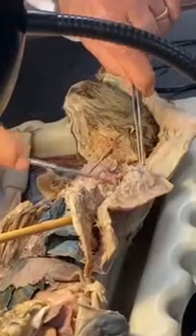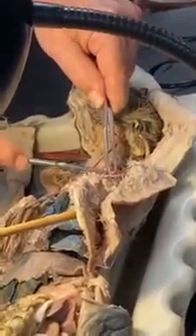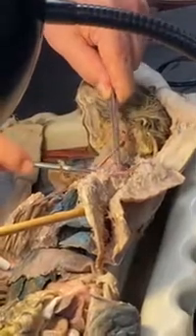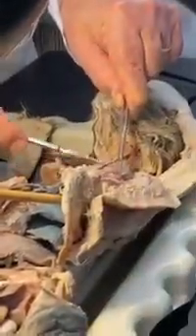Where's ventral? Well, there's the hole for it. Nope, there it is. I actually got it. Look how skinny that is. That's why you don't see that on the practical. Ventral thoracic. VL, long thoracic.